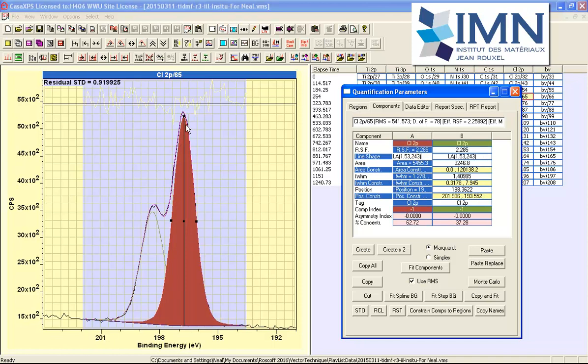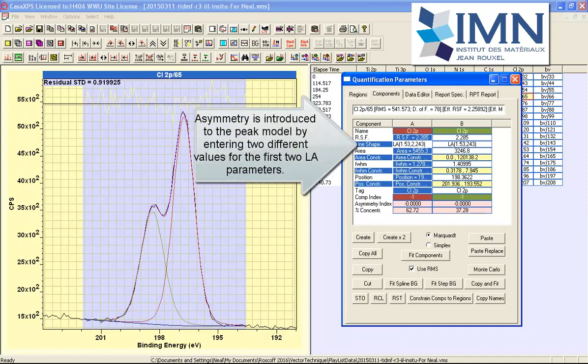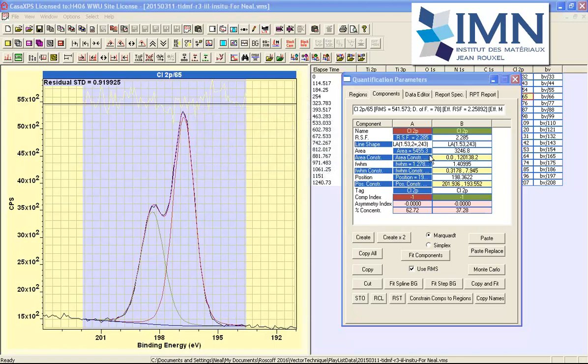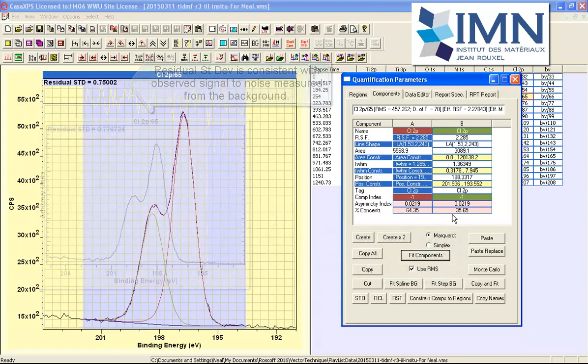So let's see this peak here. You can see there's a tail here that is not fitting the data too well, corresponding to this hump in the residual. So what I'll do is I'll introduce some asymmetry. So I'm going to type in comma 2, and I'll put equals so it transfers to the other component as well in column B. And then we'll say fit, and we end up with a much improved residual. So this is closer to what we might expect for these type of data, and the ratio has improved.